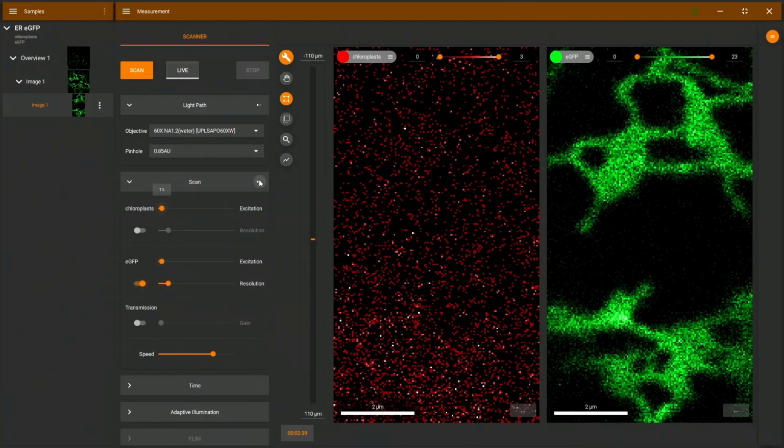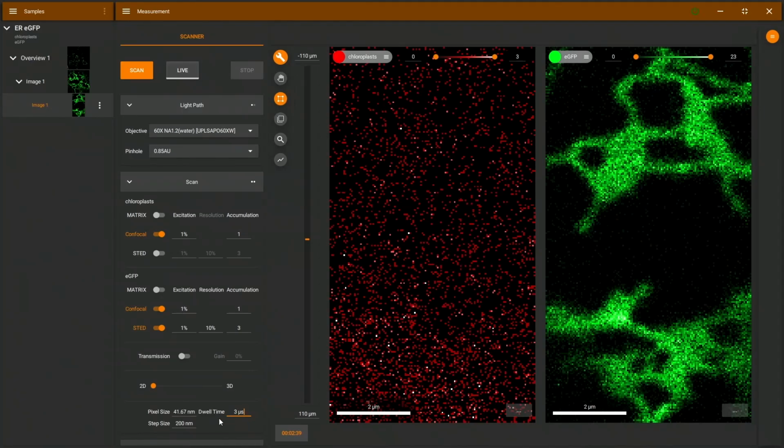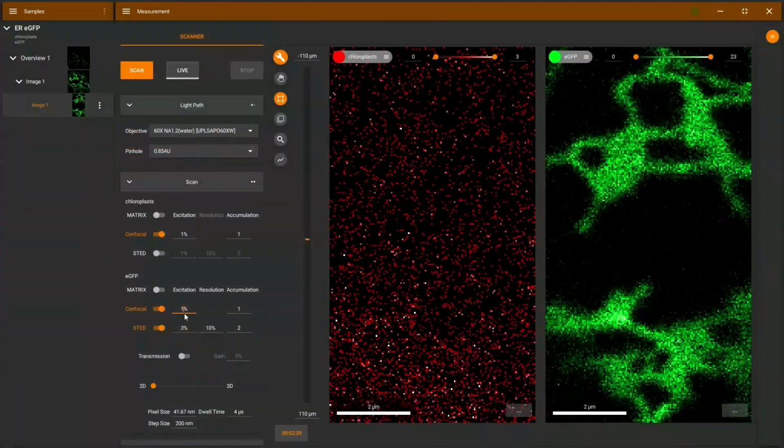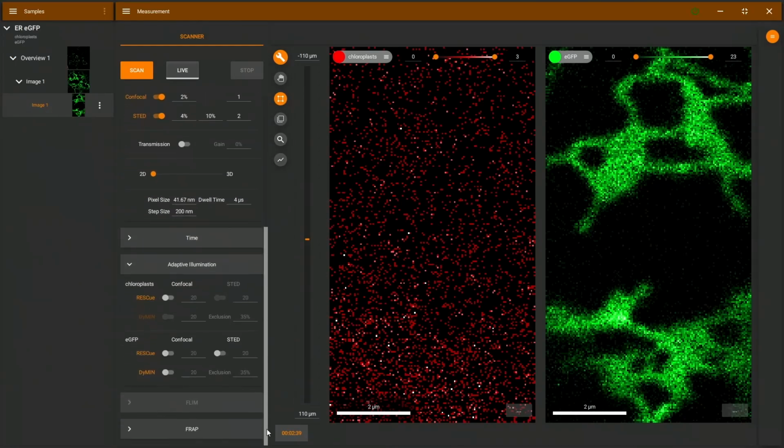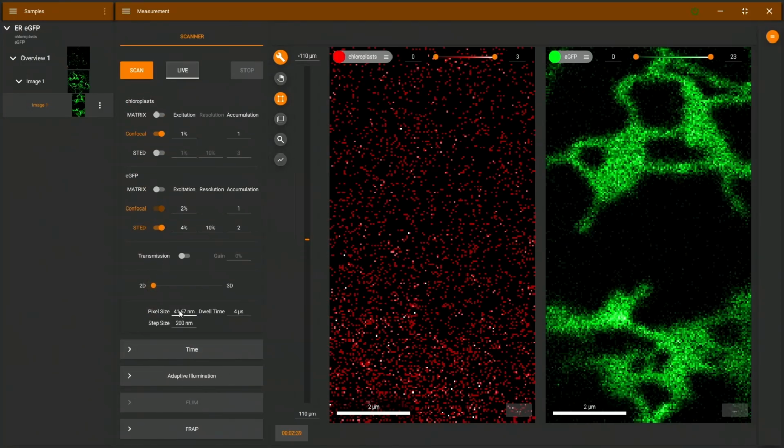I will activate STED for the GFP, and I will change the dwell time a little bit. Accumulations are also changed manually here a little bit. Crank up the excitation slightly. And we also need to go to adaptive illumination. And we activate adaptive illumination here for eGFP. And this is the level above which we will use the STED laser. So in the black areas, we have low counts, and we will not activate the STED laser there. Pixel size, adapt this to about 35 nanometers here. And we will also deactivate the chloroplasts because there's none here.